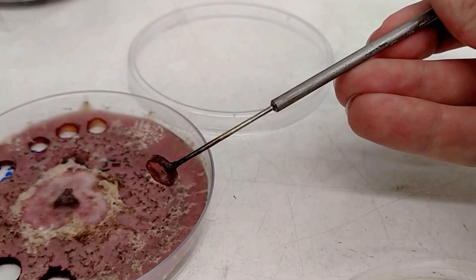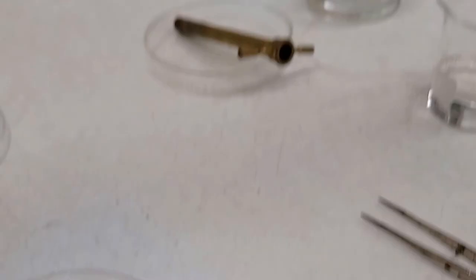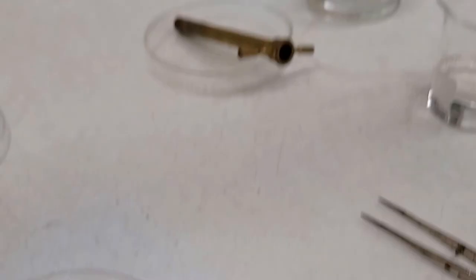So here we go and then we're going to put it on the TSA, the tryptic soy agar, face down and that's pretty much it.